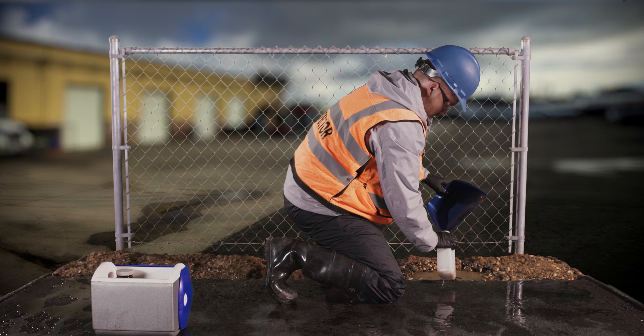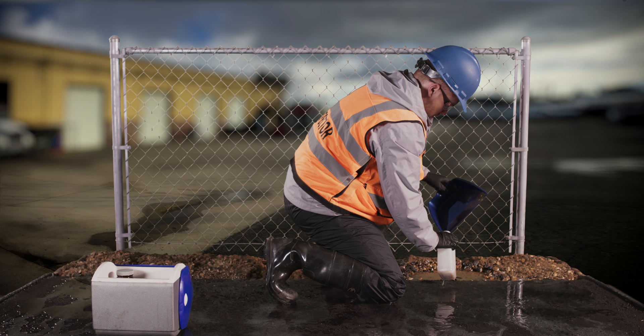First, it looks like he is using a dustpan to try and collect his sample. Although this may sound reasonable, the analytical method used for testing oil and grease does not allow water samples to be transferred from container to container, or the result may be biased low. No intermediate containers or sample collection devices may be used to collect an oil and grease sample. Dustpans, pitchers, or plastic bags are not allowed, as oil tends to stick to the sides of intermediate containers, removing it from the sample and causing inaccurate analytical results.